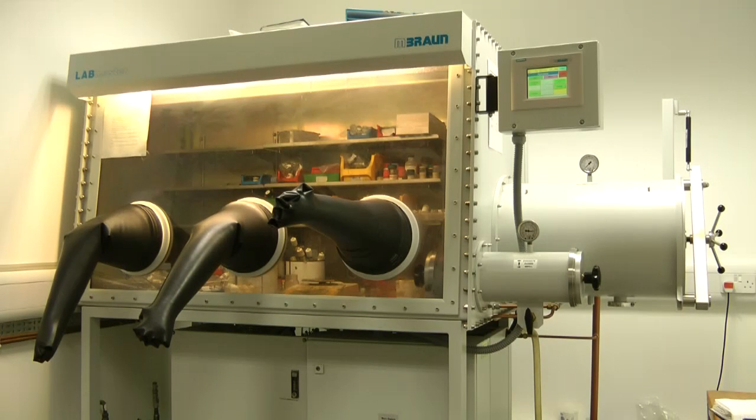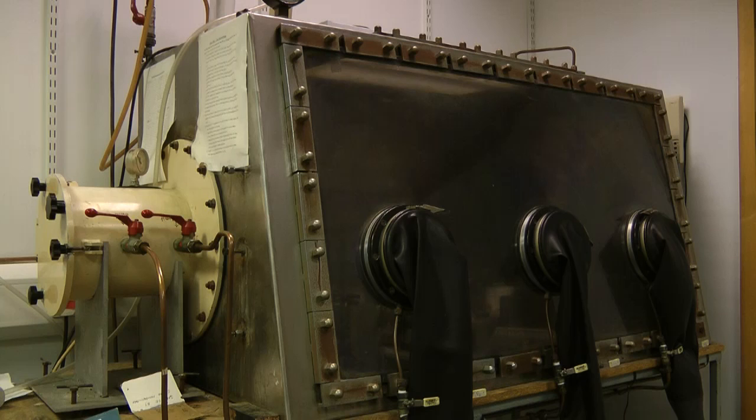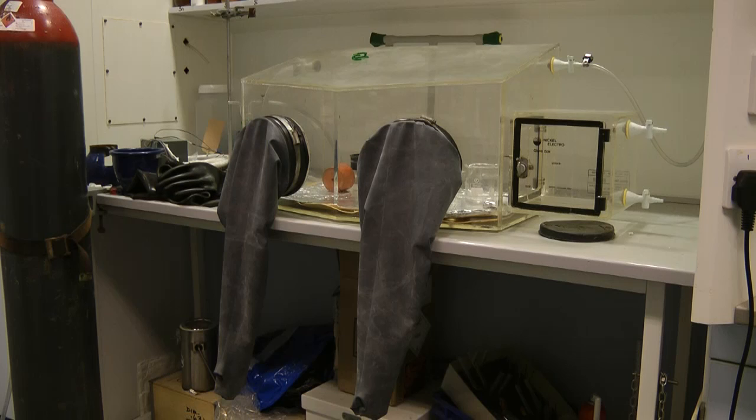Glove boxes come in a variety of shapes and sizes. If your group has a specialist glove box, you'll be taught how to use it within your group. This primer will deal with how to use a commonly found glove box within the University of Southampton.